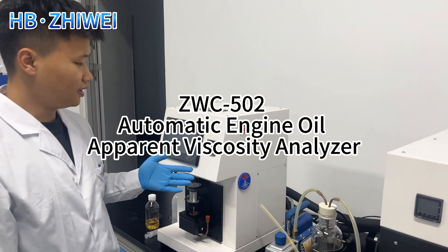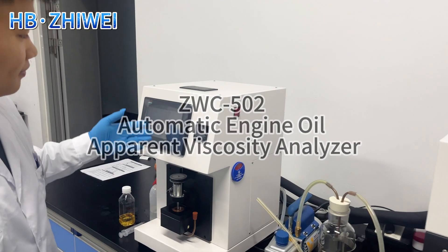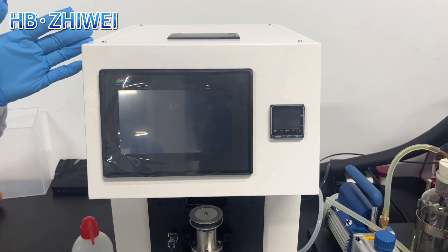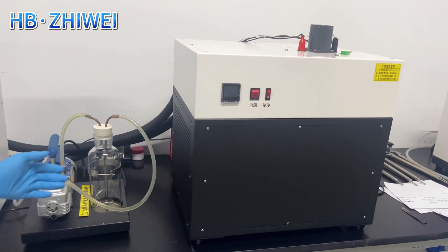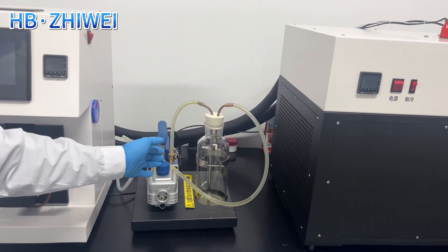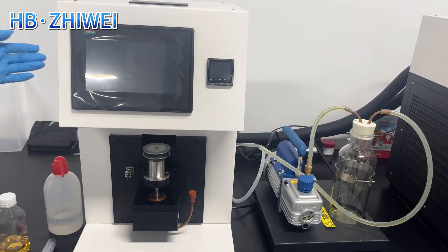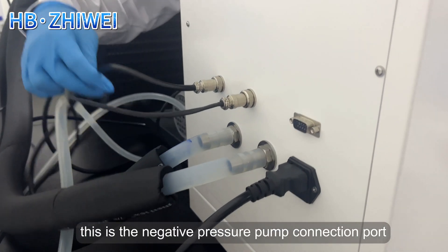Now let's introduce the ZWC502 Engine Oil Apparent Viscosity Analyzer. This is the test host. This is the refrigeration device. This is the negative pressure pump. This is the negative pressure pump connection port on the back of the main unit.